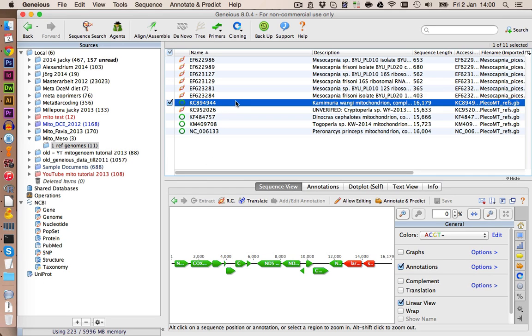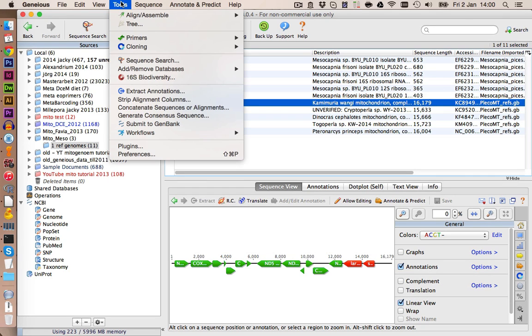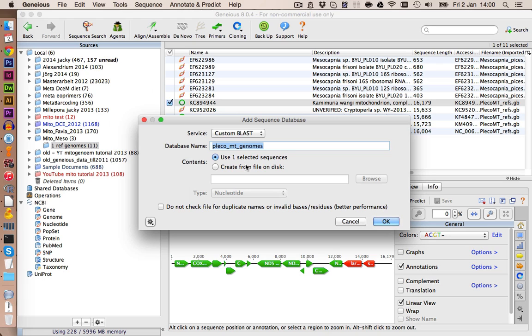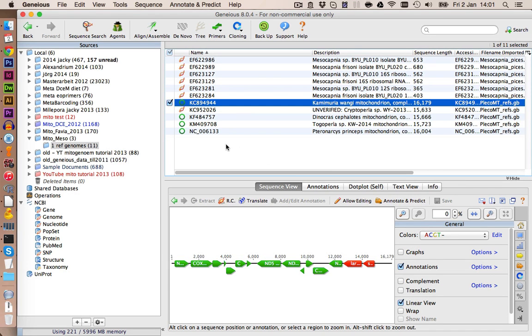To add this to a database, you need to go first on Tools, Add/Remove Databases, and then Add Sequence Database. I would recommend to use the same name as it is in the NCBI ID. So let me type this down really quick. And I also added the species name in the end to know which stonefly it is. We can click on OK. And now this was added to our database inside of Geneious.